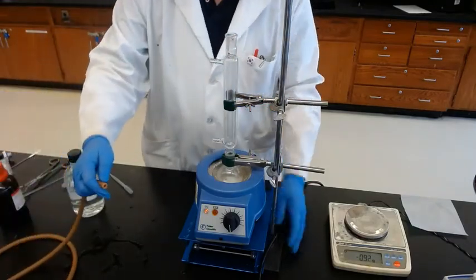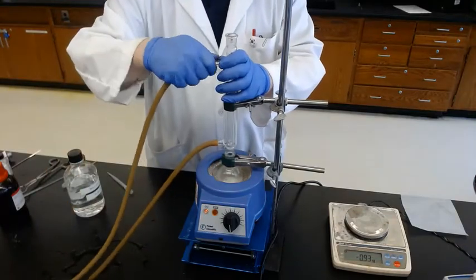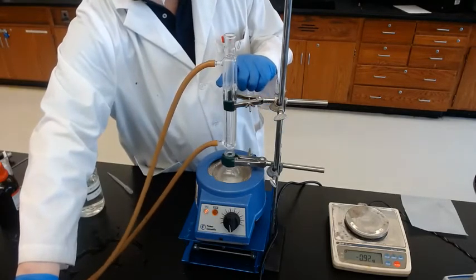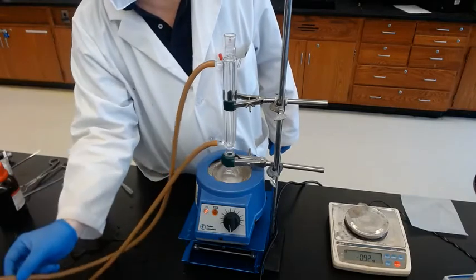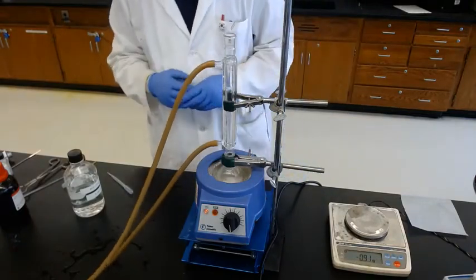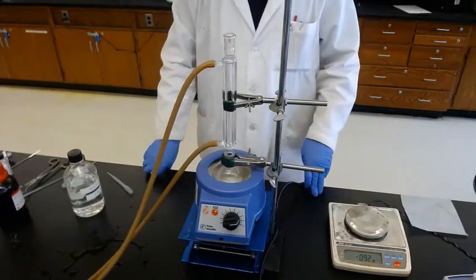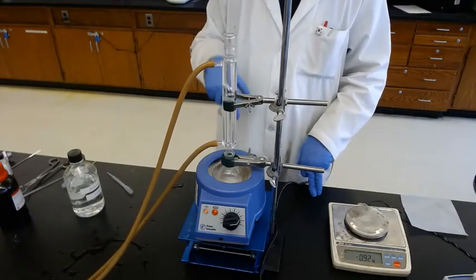Connect the water lines: water goes in from the lower port and out from the higher position, so the condenser will be full of water. Gently turn on the water and check that water is flowing out. Water doesn't need to flow a lot — just enough to keep the cold water circulating inside the condenser. Now it's set. Turn it on and set to 70%. We will reflux for one hour — the one hour starts not from this moment, but from when the solution is boiling.